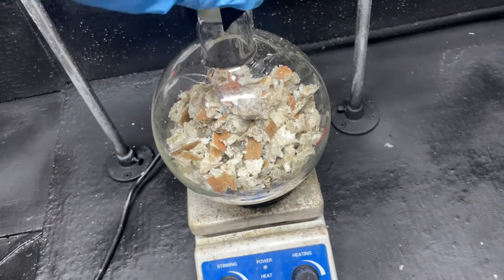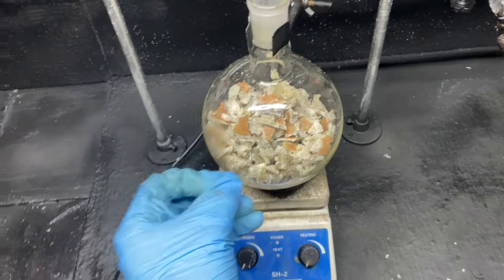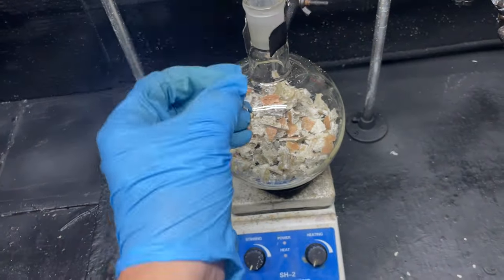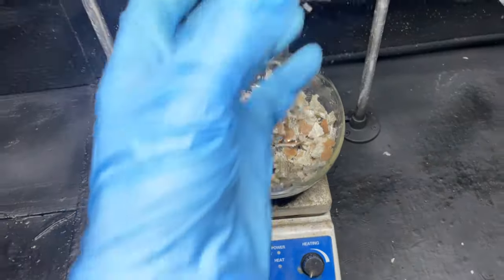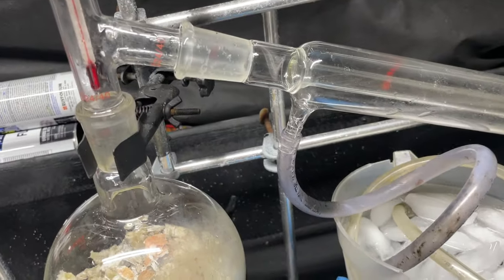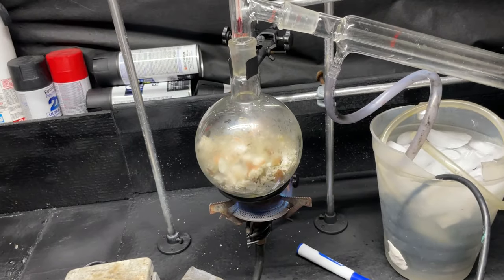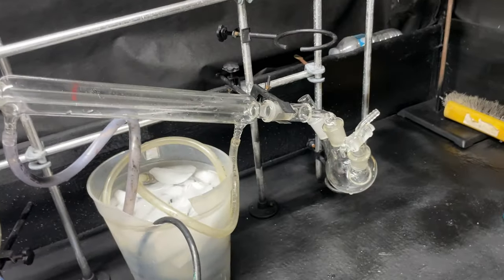We're all ready to go and I'm going to set this up for a simple distillation. We've got to heat this to around 400°C and maintain it at that temperature. 400°C will get the most liquid fraction over, which is what we want to get our most aromatics over. This is going to be a really messy process — not going to be fun glassware to clean when this is done. I'll come back when we start getting our pyrolysis oil.